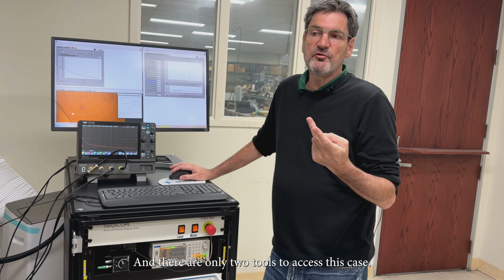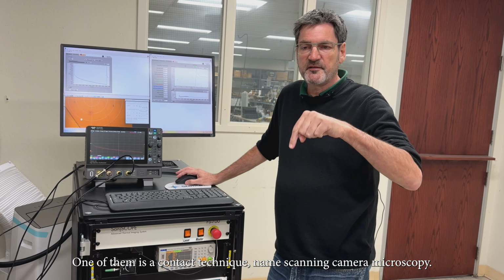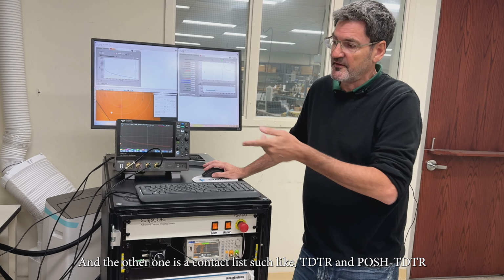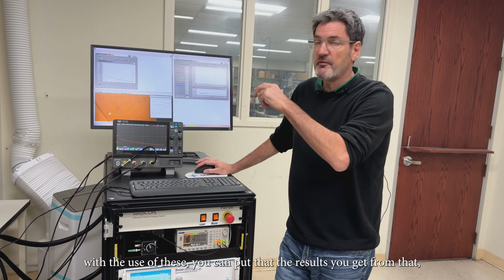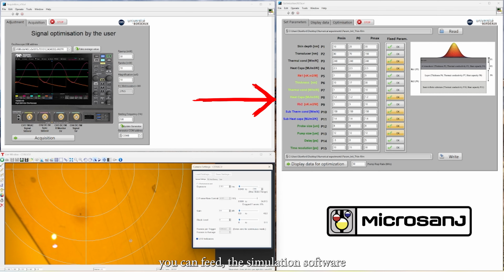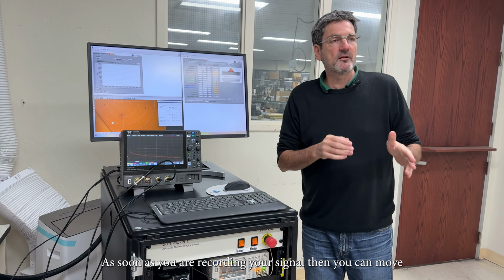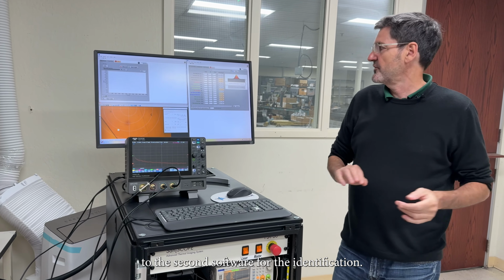And there are only two tools to access these scales. One of them is a contact technique named scanning thermal microscopy. It's an AFM-based technique. And the other one is contactless, such as TDTR and POSH-TDTR. With the use of this, you can feed the results you get into simulation software like ANSYS or COMSOL, for example. As soon as you are recording your signal, then you can move to the second software for the identification.